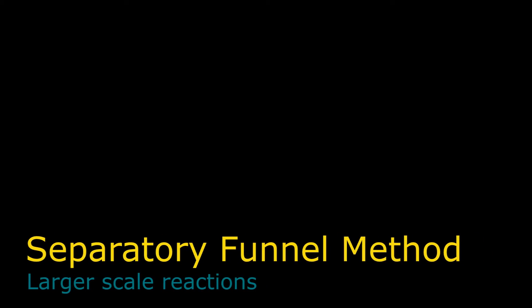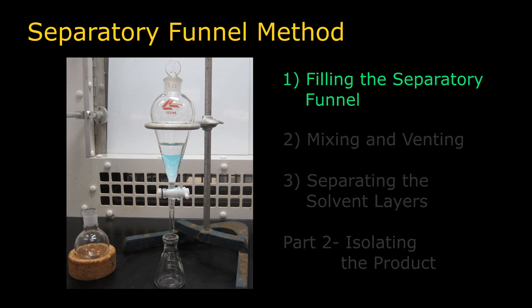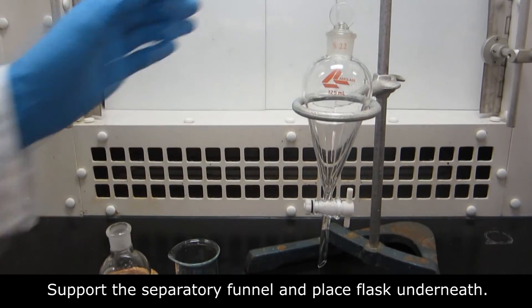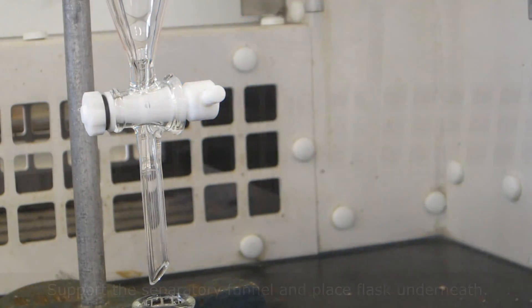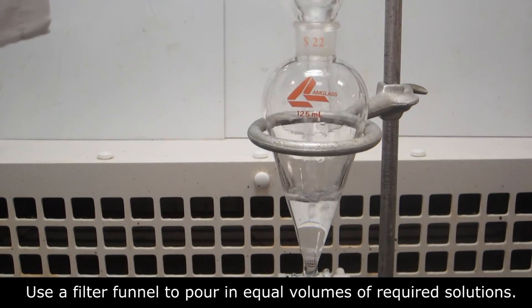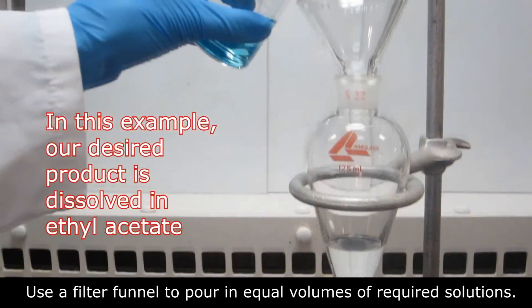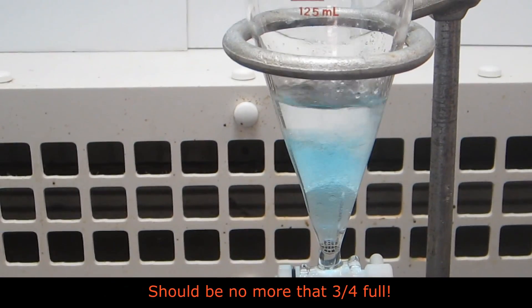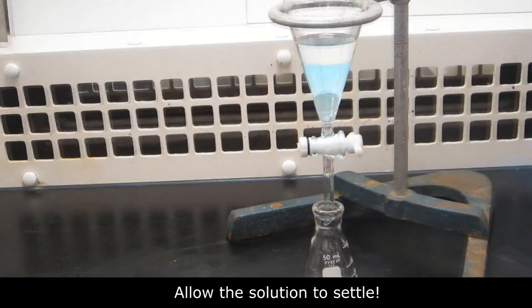For larger scale reactions, extractions are performed using a separatory funnel. Using a retort stand, support the separatory funnel on an iron ring. Place an Erlenmeyer flask under the tip just in case the funnel leaks. After closing the stopcock, use a filter funnel to transfer your reaction solution containing an organic extraction solvent to the separatory funnel, and add an equal volume of water or other aqueous solution as instructed. In this example, our desired product is dissolved in ethyl acetate. The separatory funnel should be no more than three-quarters full. You should notice the two layers starting to form after the solution has had some time to settle.